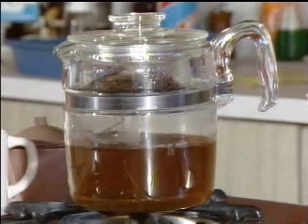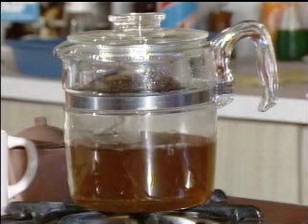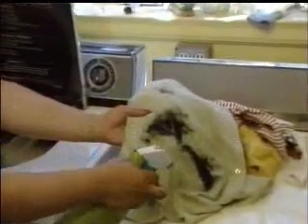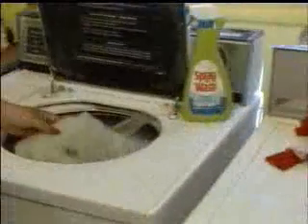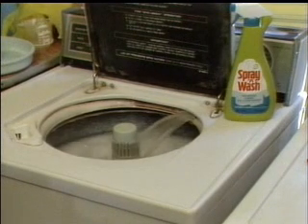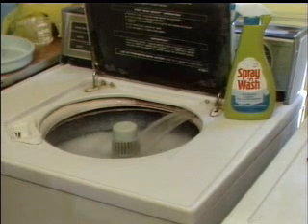In addition, many extractions involve the transfer of material from one liquid phase to another liquid. As an example, clothing stained by oil can be cleaned by an application of cleaning fluid. This is extraction of a liquid, the oil stain, by another liquid, the cleaning fluid. Liquid-liquid extractions involve the separation of a compound from a mixture based upon the distribution of the compound between two immiscible liquid phases.